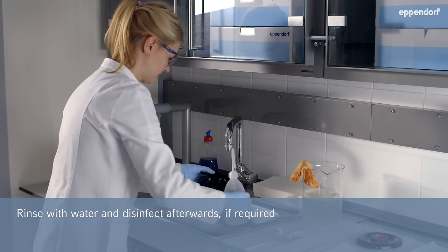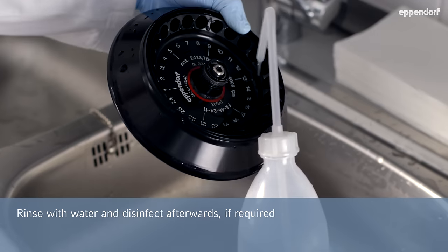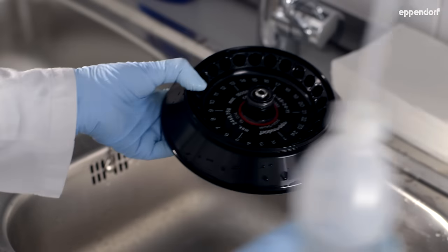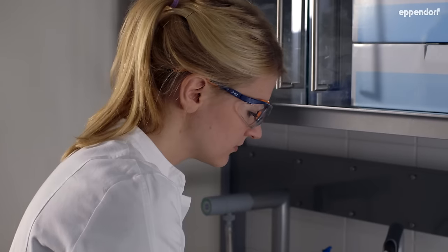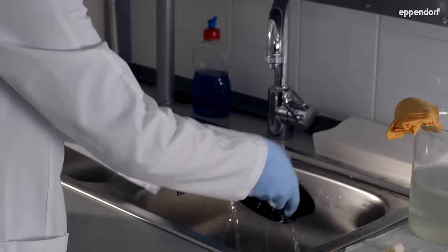After rotors and your centrifuge equipment have been rinsed with water, 70% isopropanol or other diluted alcohol-based disinfection solutions can be used for disinfection.